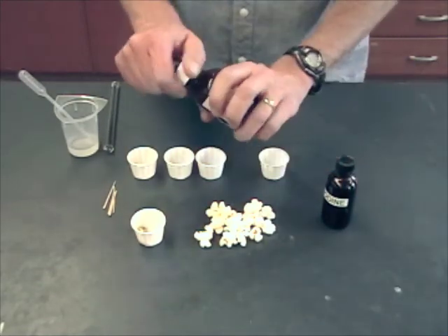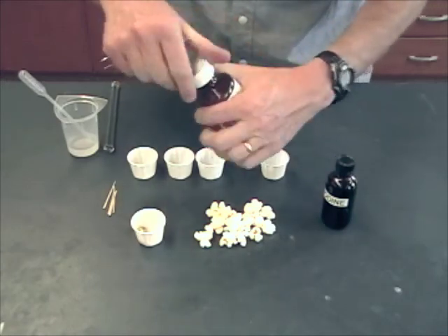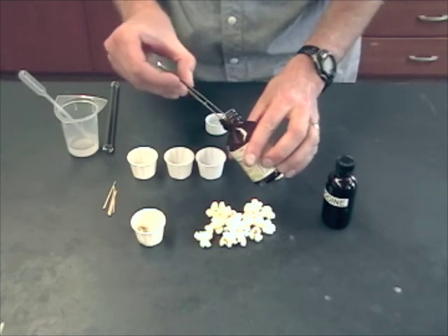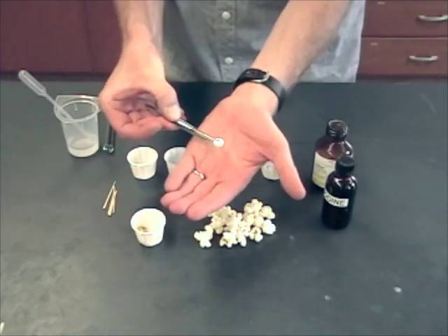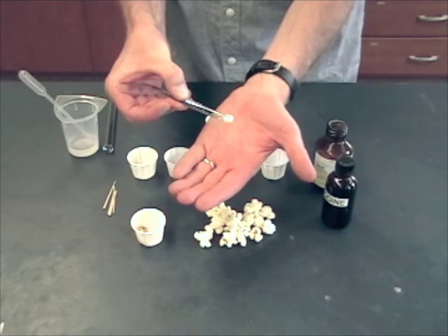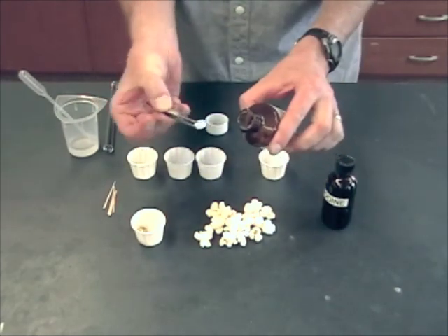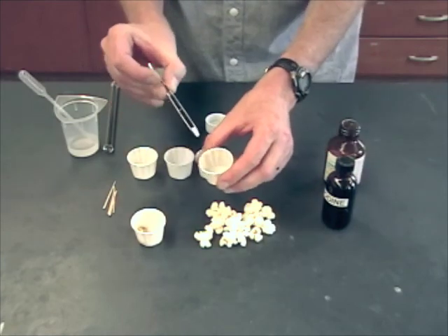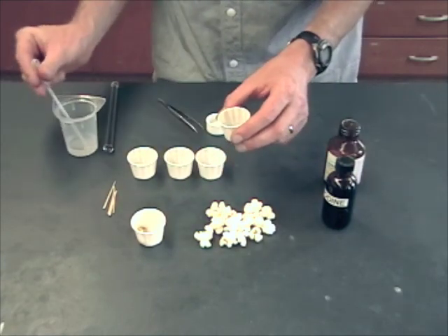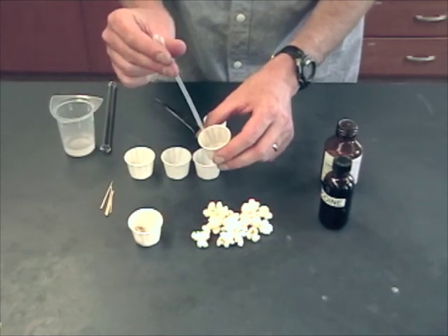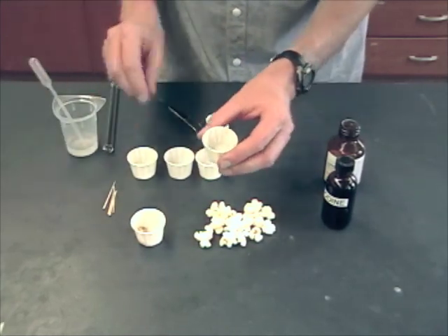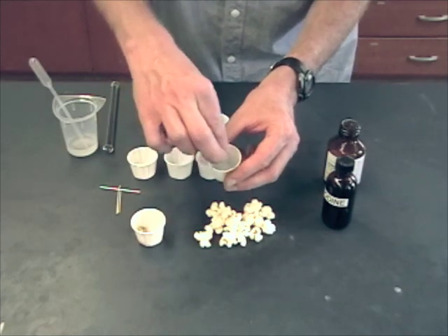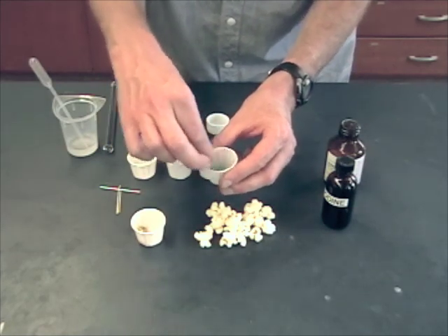One thing important about the ClinTest tablets is that they contain sodium hydroxide. That actually helps them dissolve better. But it also means that if you sat there and held one in your hand for a long time, it would start to melt and you might get a little burn on your hand. So we encourage people to handle them using the forceps here. And when you're ready to use one of them, you can put them in your cup. They need to have a little bit of liquid with them. That could be water or saliva or anything else. And you'll see that they start to fizz up. And it's actually kind of helpful to use one of these little toothpicks to mix it up and make sure that it gets completely dissolved.